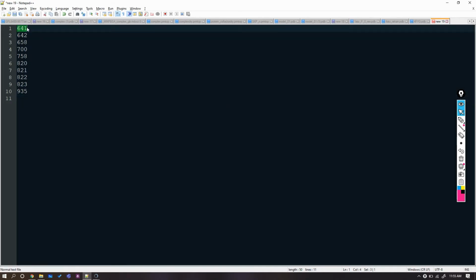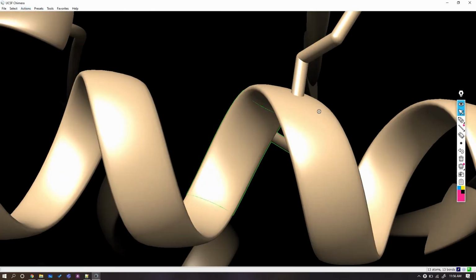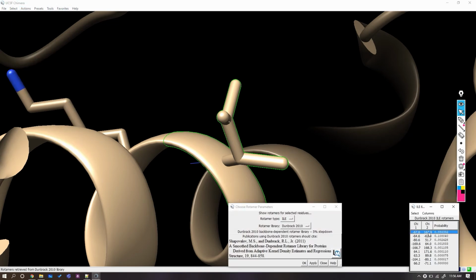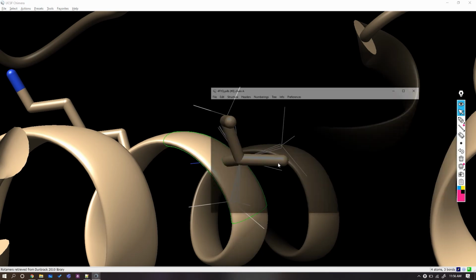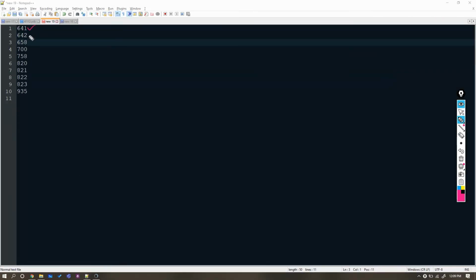Let's do this again now for residue 642. So I will do it a bit fast and note the time. It requires a little bit more time, which is a complete mess if you have a lot of residues like we have in our PDB file. Until now we have changed the rotamers manually. We will now use scripts to do it a bit faster for the rest of the duplicated residues.